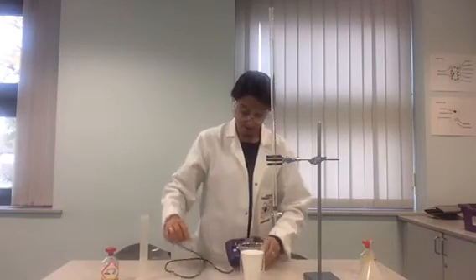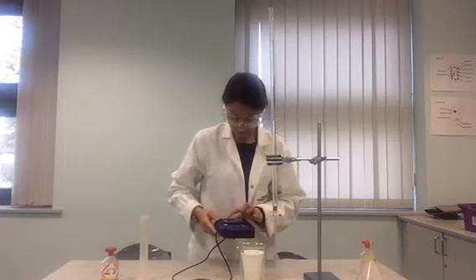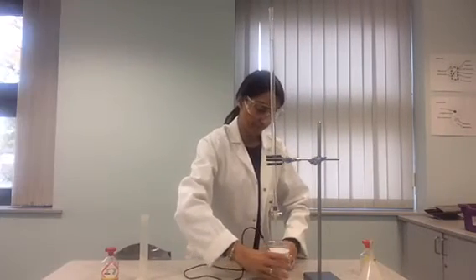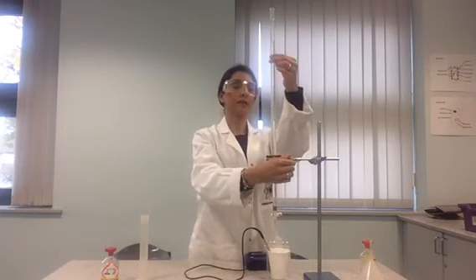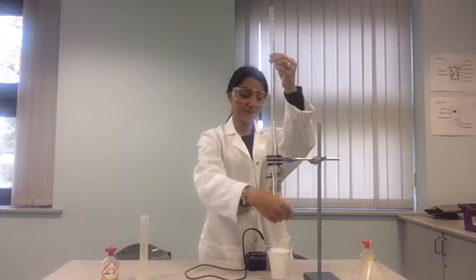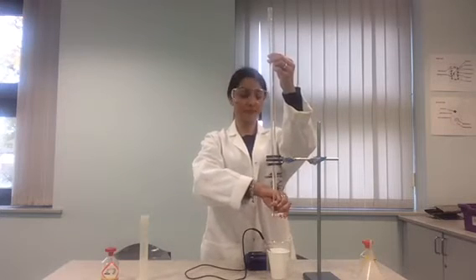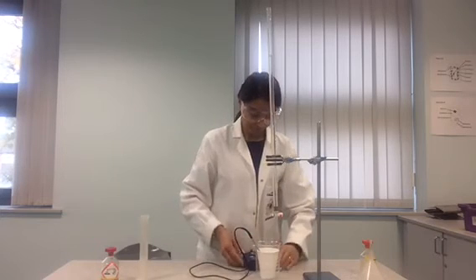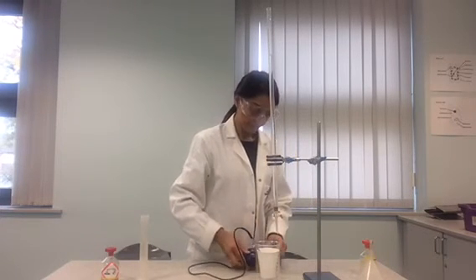Now use the temperature probe to record the initial temperature of the sodium hydroxide and record your results in your table. Now add 5cm³ of hydrochloric acid from the burette into the polystyrene cup with sodium hydroxide by turning the tap gently to open and close. Stir the solution and record the highest temperature that the reaction reaches.